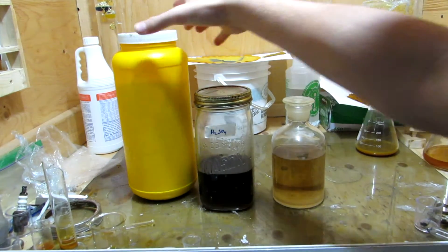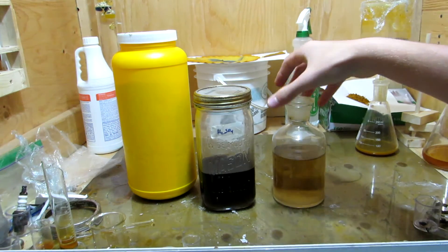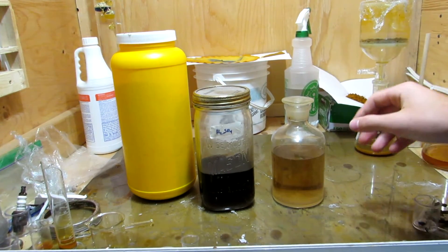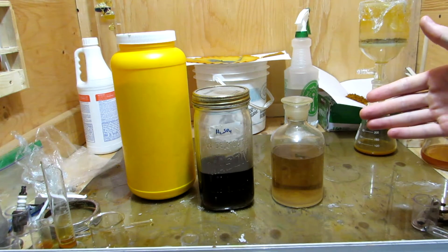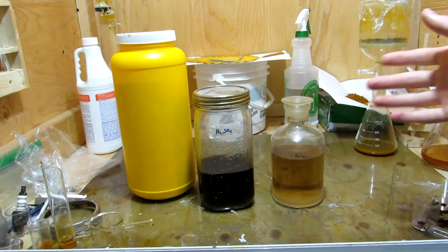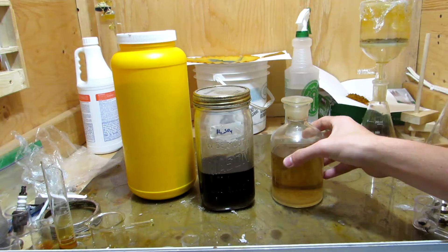The sulfuric acid that I'm going to be using here is dirty sulfuric acid, around 70% concentration, and this was just recovered from some other reactions. The main contaminant here is water, of course, however there are some other salts, but they will not interfere with this particular reaction.